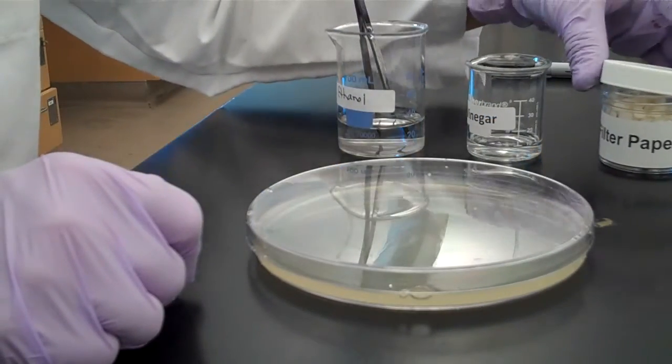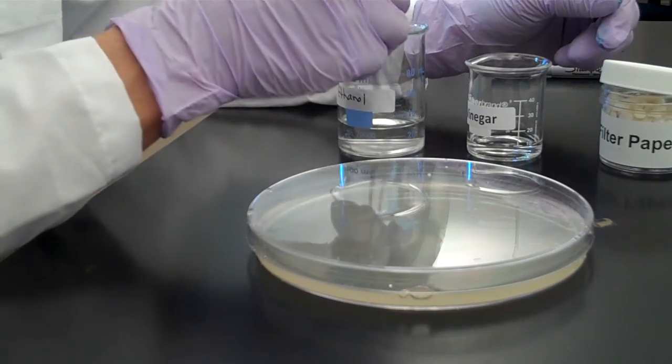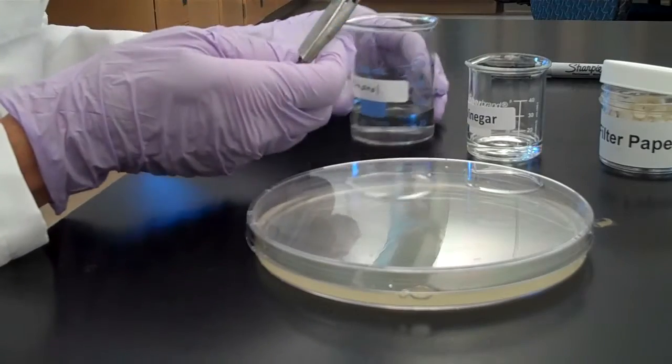Now we're going to demonstrate the antiseptic disinfectant part of the lab. Take the tweezers out of the alcohol and let the alcohol evaporate.